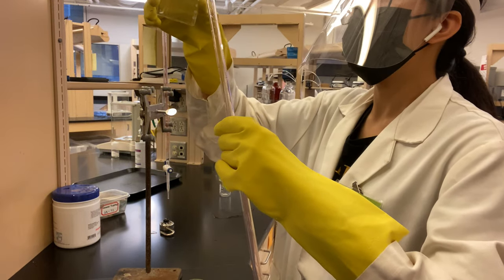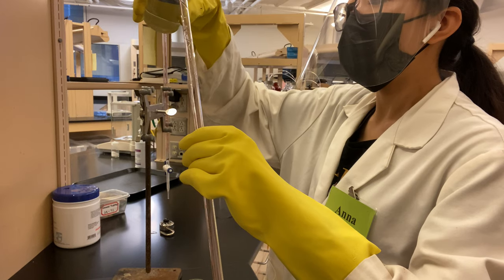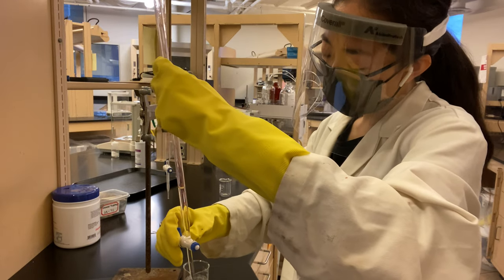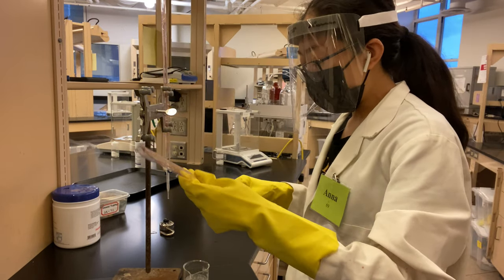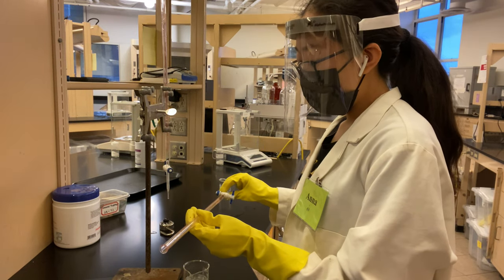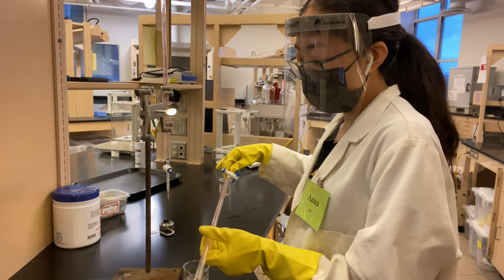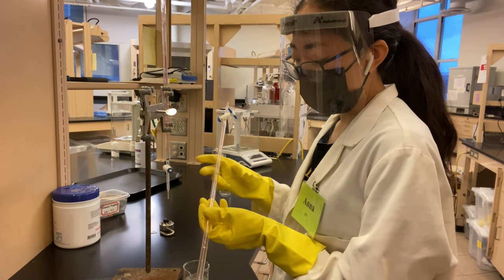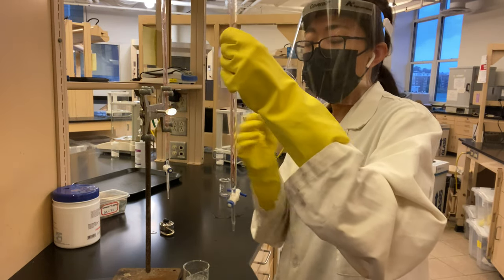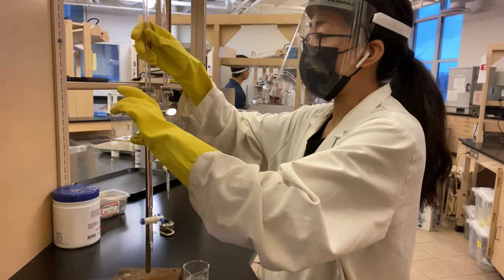So we're just going to do the same thing over here — just put the water in here and then swirl the top to get any of the excess water out. Okay, perfect. So now we're going to place it in the stand here.